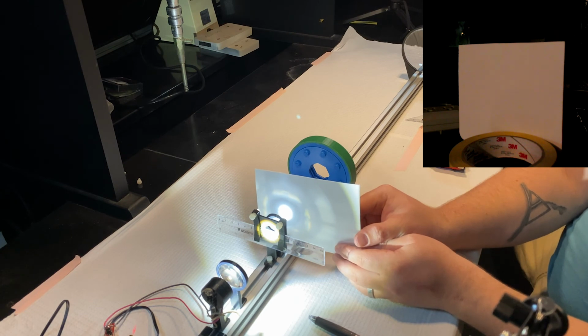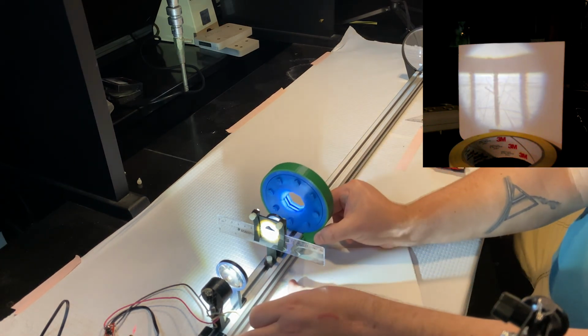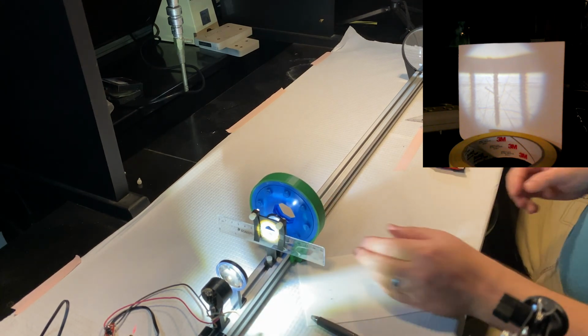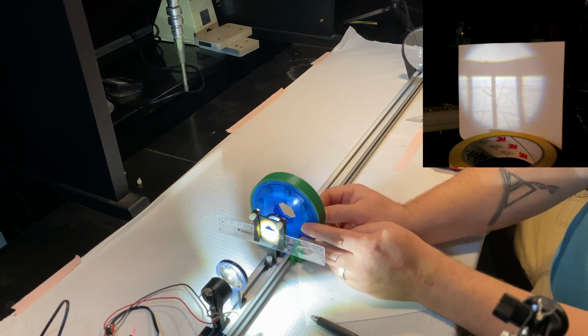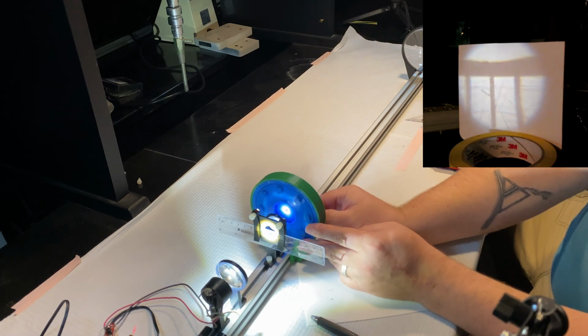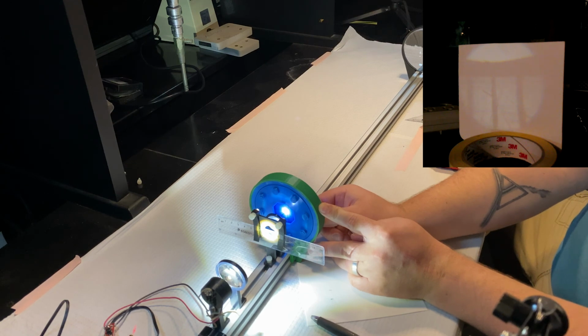It's right about there. My field of view hasn't changed when I keep this open or when I close it. You can see the same amount of the sample either way, but in the open case, it's quite a bit brighter than in the closed case.